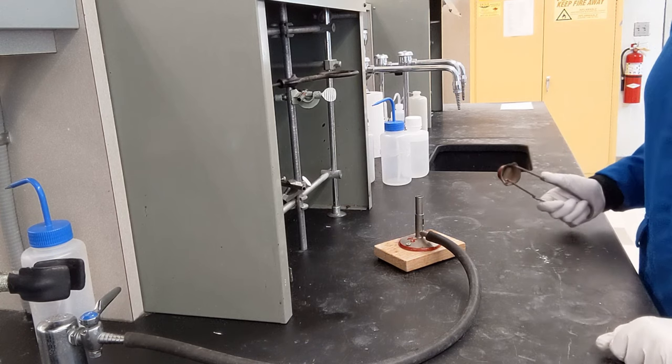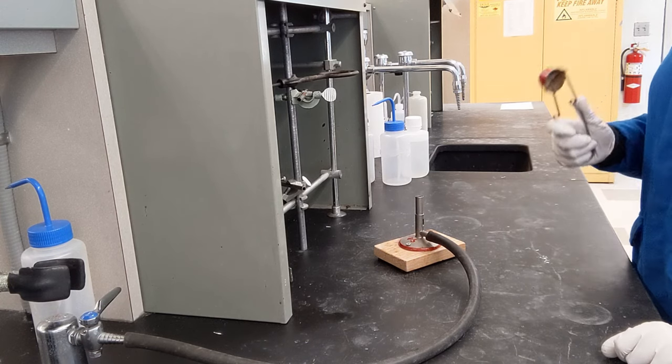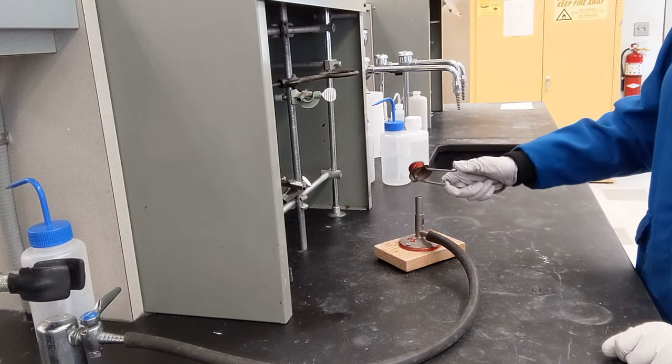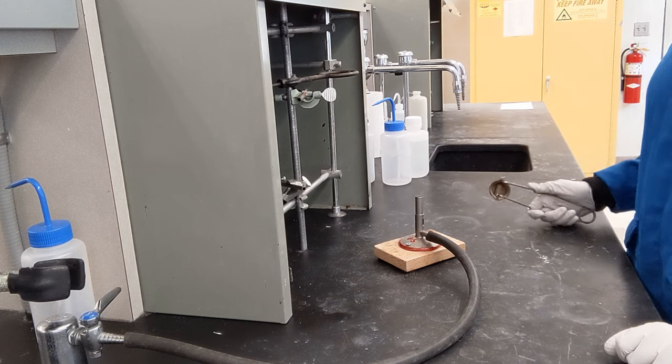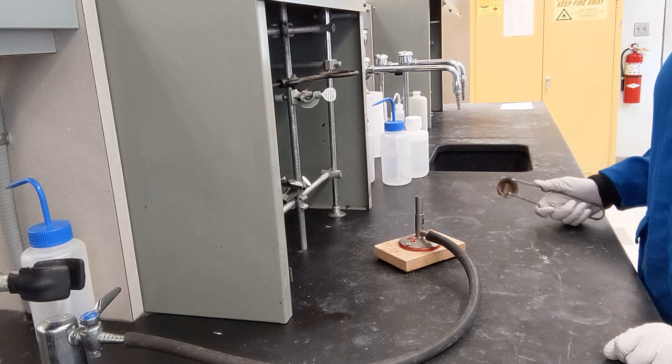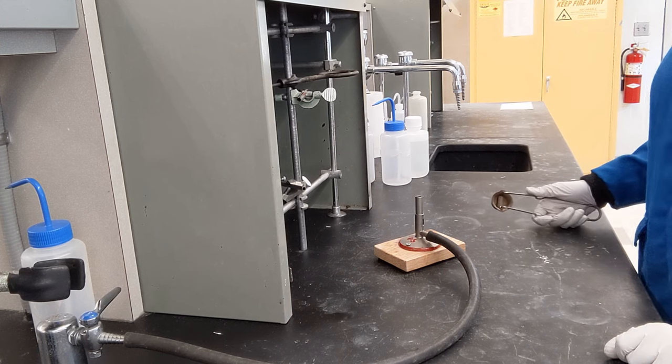So let's say you're having trouble igniting this. Let's pretend the gas is on and you keep striking over and over and over and you just can't get it to light. Do not just indefinitely try.